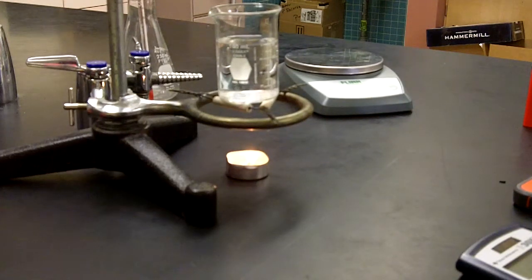So I'm going to use the thermometer to stir that water around so that you get a nice even distribution of the hotter water from the bottom to the cooler water that's on the top in that beaker. So to kind of mix it all around, get a nice even temperature. I'm going to want to get a read within about 30 to 60 seconds, no longer than 60 seconds, but as soon as possible. And then get the mass to the nearest 0.1 grams when that candle wax solidifies. And then that'll be our conclusion.